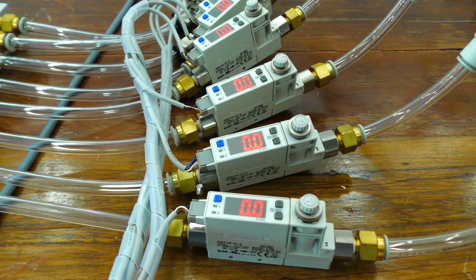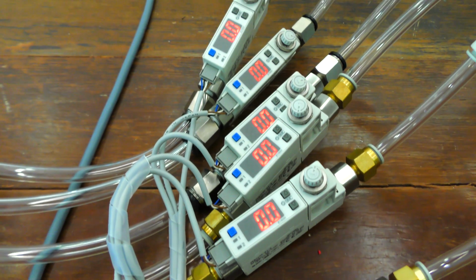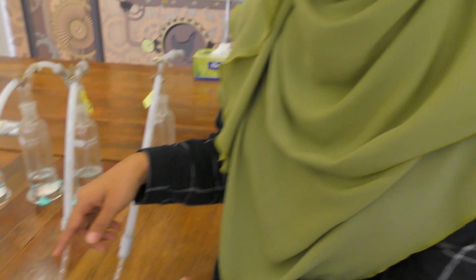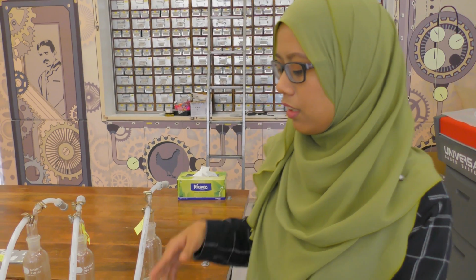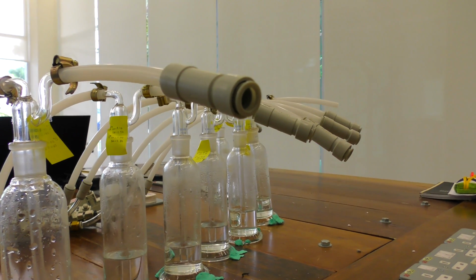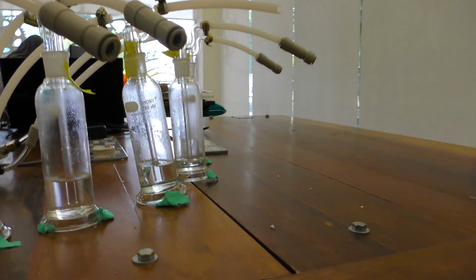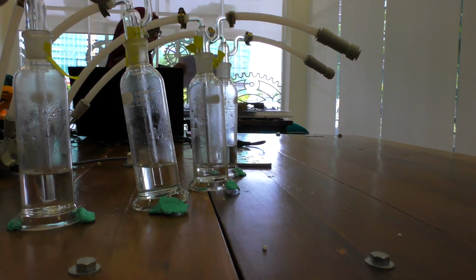2-color digital flow switch, where we must make sure that the flow rate here is between 3 to 5 liters per minute, to make sure that our nose is comfortable, because more than 5 liters per minute will make our nose uncomfortable. After that, this air will flow to the glass bottles which contain different smells, different odors, and as a result, we will smell the different smells here.